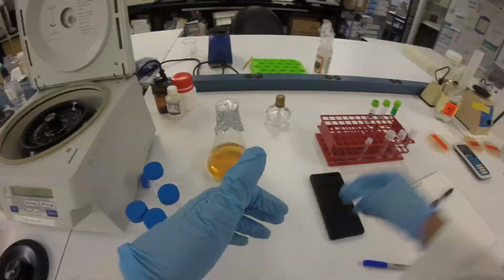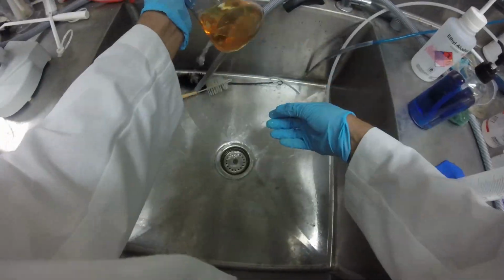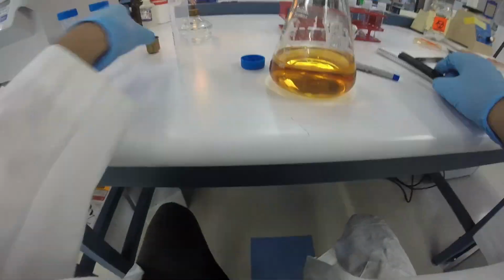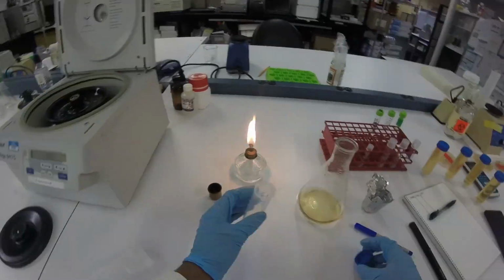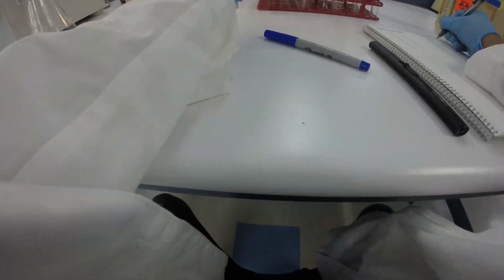So we have basically three 14 milliliter culture tubes in different environments: room temperature, 30C, and 37C. Basically every 30 minutes, I would go collect my culture tubes. I would take the cuvettes and add 1 milliliter from each environmental condition culture tube into the cuvette. At the very beginning, I took 1 mL of LB that I started with and put it into a cuvette, and every time I took a sample, I blanked on that.